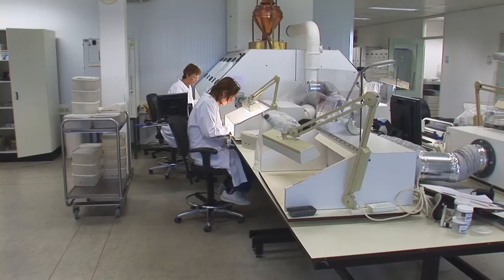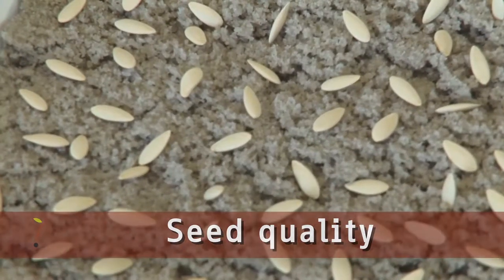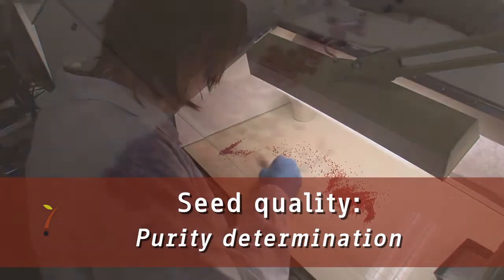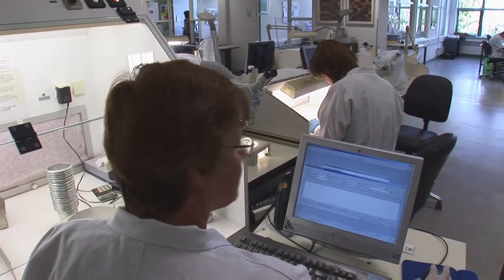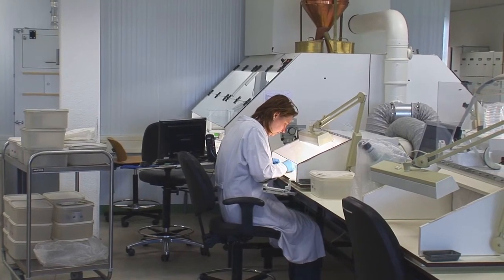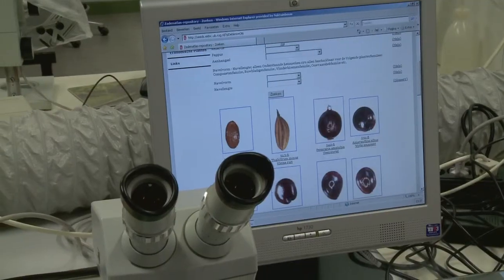Another section of the Naktuinbouw Laboratories is equipped to conduct tests on seed quality. The most important tests on seeds are for purity, germination power, moisture content and a usable plants test. Purity determination looks at the extent to which a seed sample is free of impurities. Once the sample has been weighed, the impurities such as plant residues, sand or soil are separated from the seed and are individually weighed. This indicates how pure the sample is. Sometimes other seeds are discovered in the samples. These seeds can be identified by comparison to the Naktuinbouw seed collection and the online seed atlas.